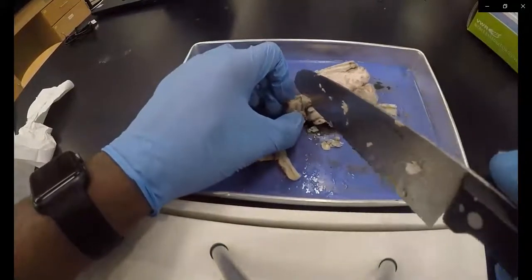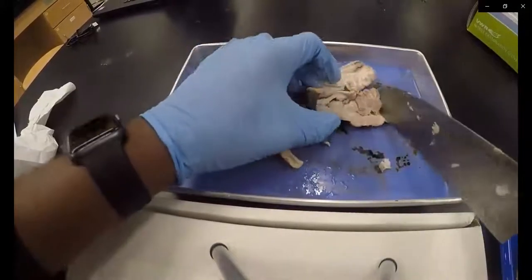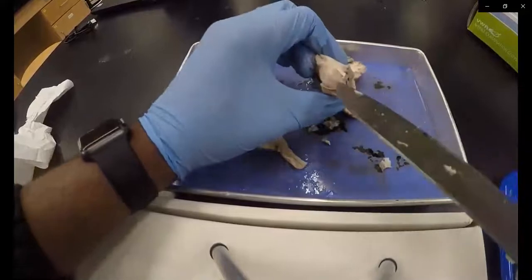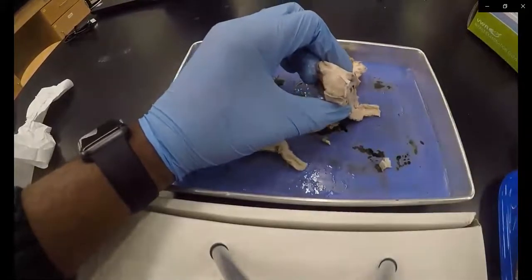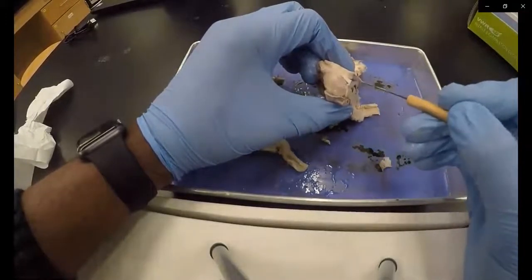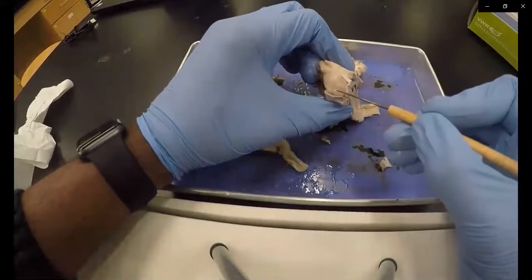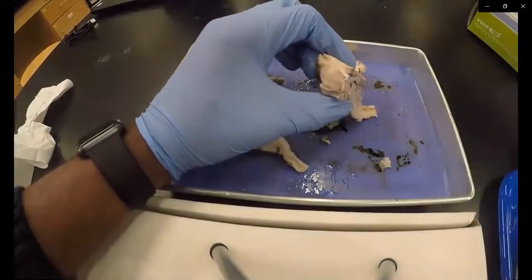If you perform a coronal cut, you will be able to see the striatum. The striatum highlighted here also includes the nucleus accumbens, that white dot.